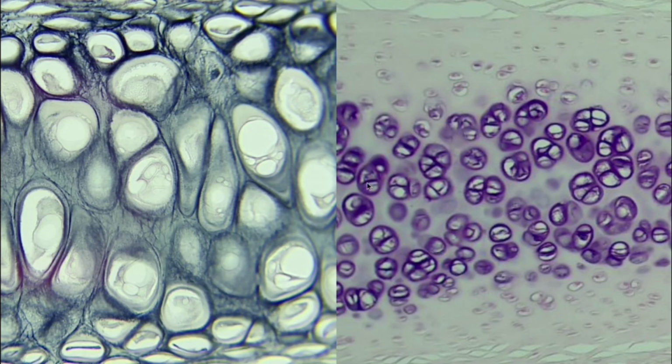But on our hyaline cartilage, so smooth, very glassy looking. It is no fibers. We can see some of them on the inside, and I think that confuses some people, but we're looking for the space between the holes. You can see that difference. Lots of fibers. No fibers at all, almost blurry.